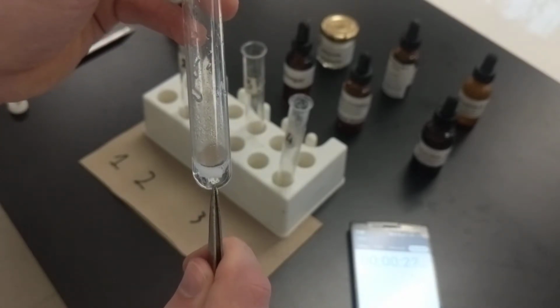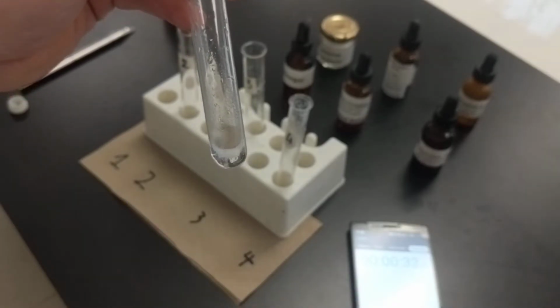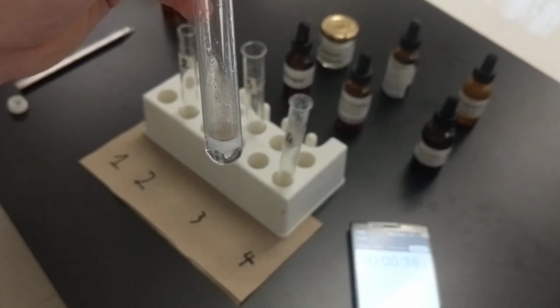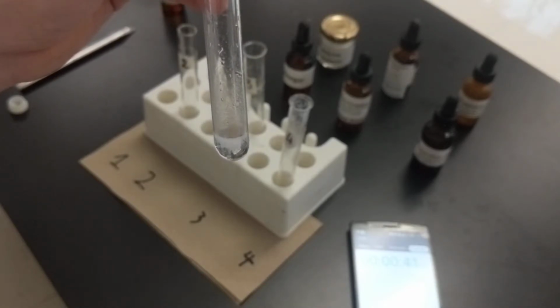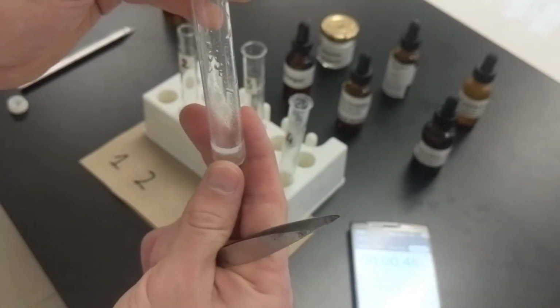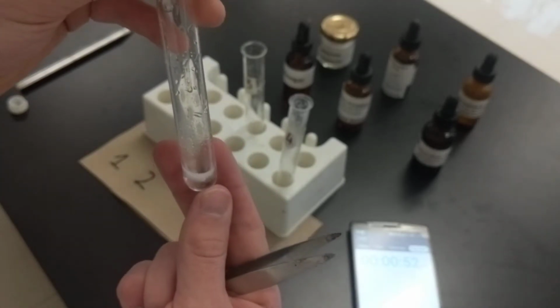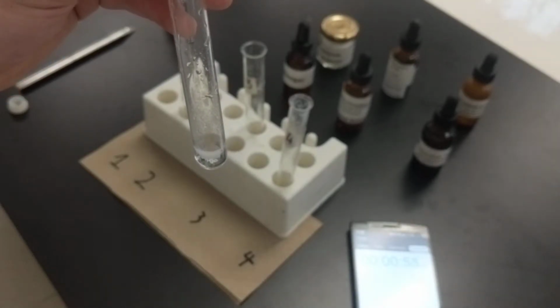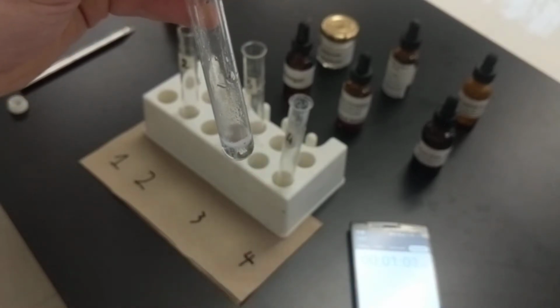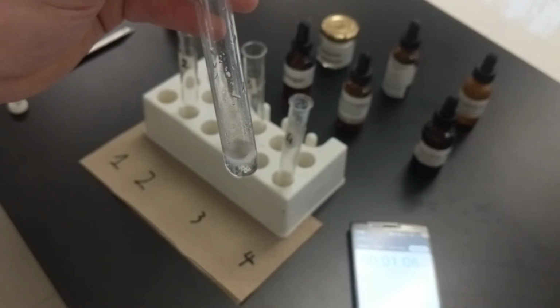Still going strong. It's right here. It looks to me that that strip has become a little bit smaller on all sides, but not much. Not yet, anyway. Yeah, you can definitely feel that it's warm. It's not hot. Like, this isn't burning my hand, but you can definitely feel that it's warm right now. So, warm, color change, bubbling. What are we seeing?